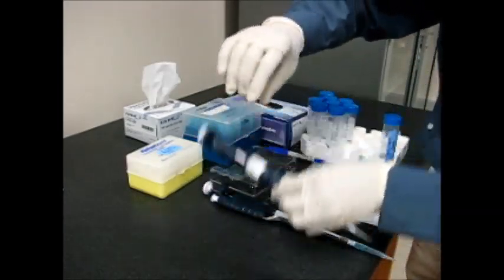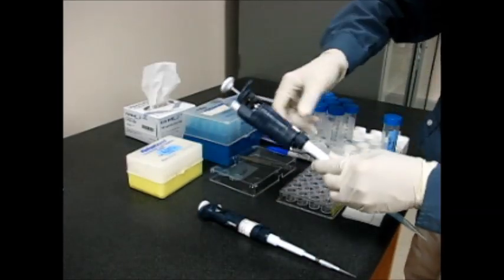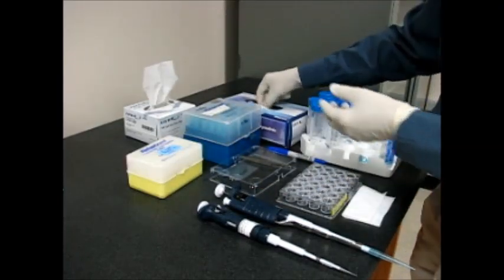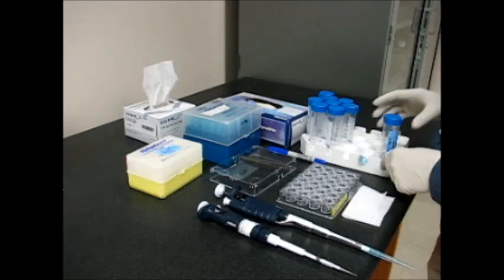We need a 20 microliter pipette with a tip, 1000 microliter pipette with a tip, some extra tips, paper tissue, and a glass for the precipitant solution and the protein.